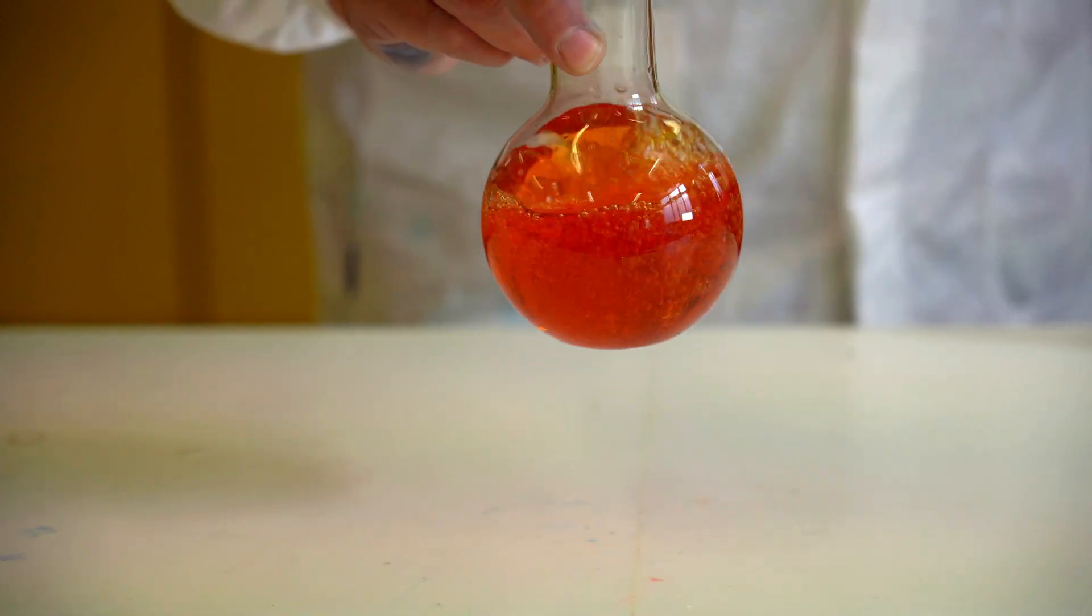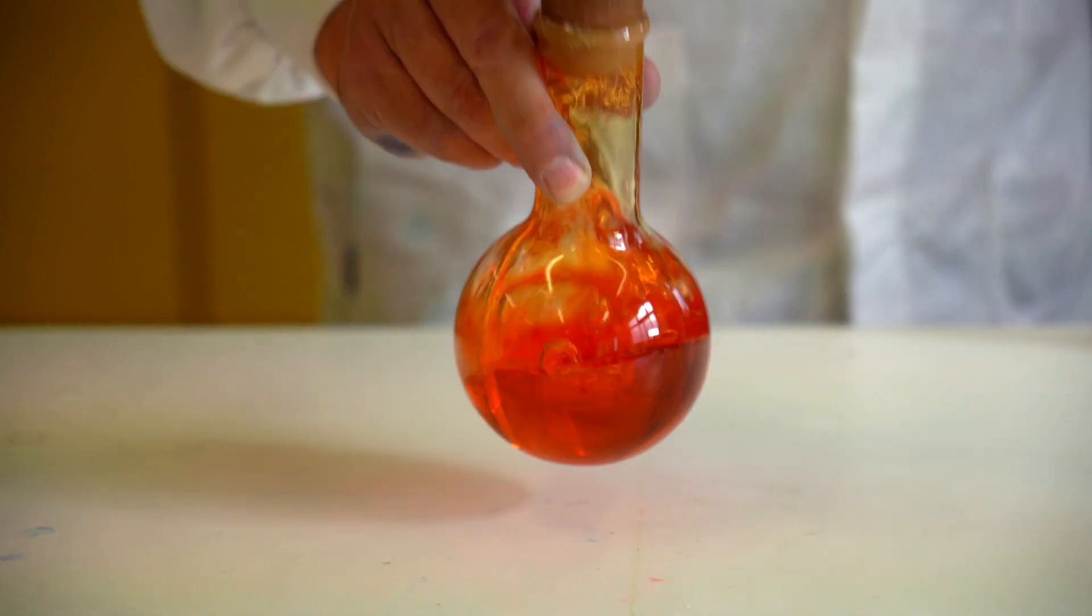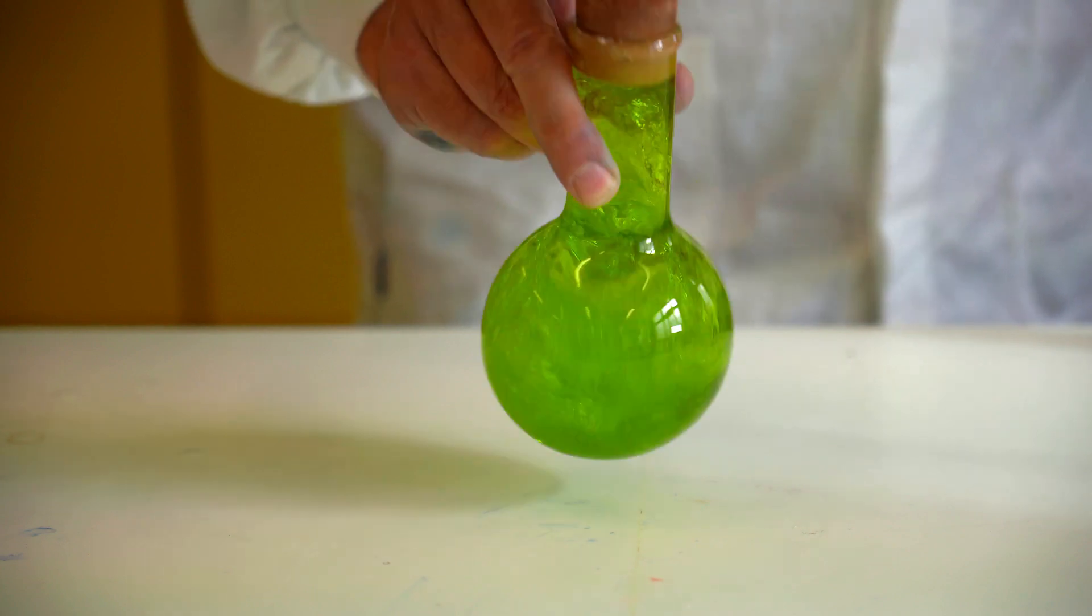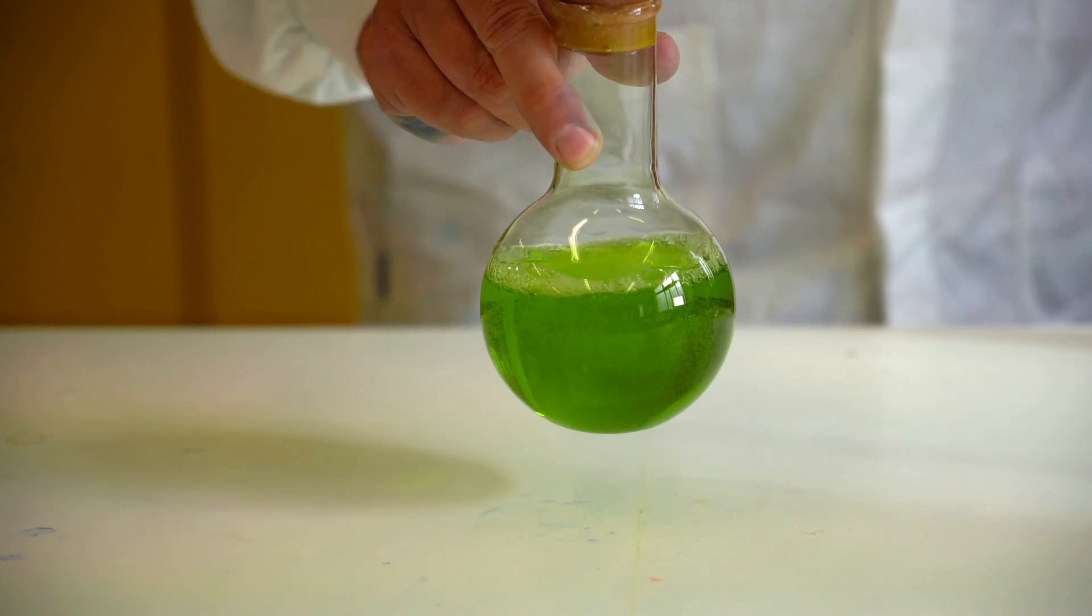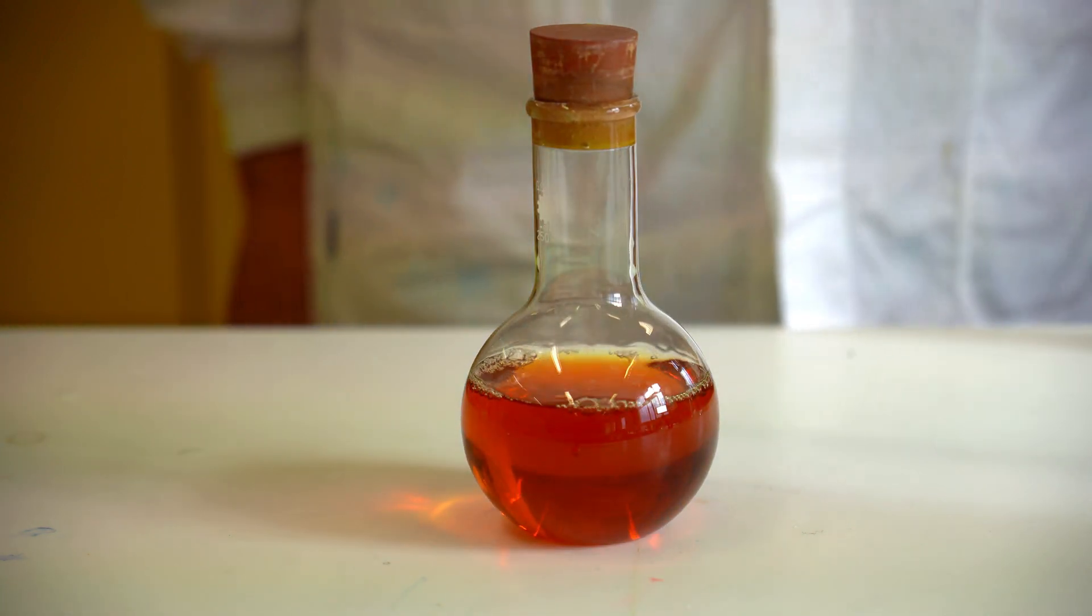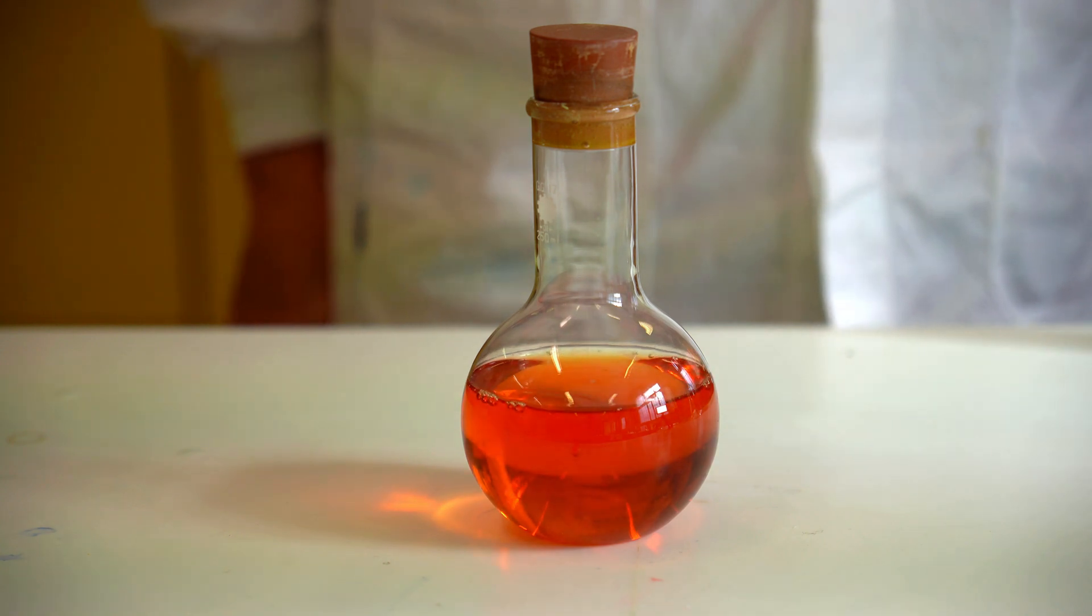Shaking the solution, it turns red and with more vigorous shaking, it becomes green. If left undisturbed, color changes follow the reverse order.